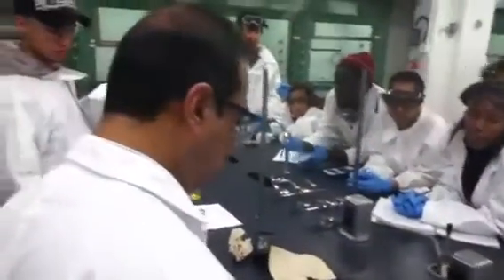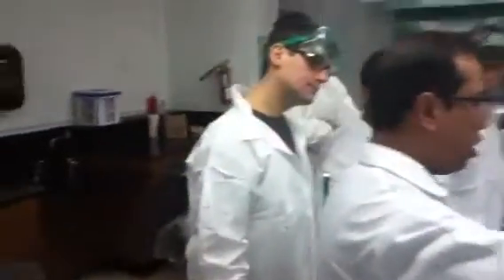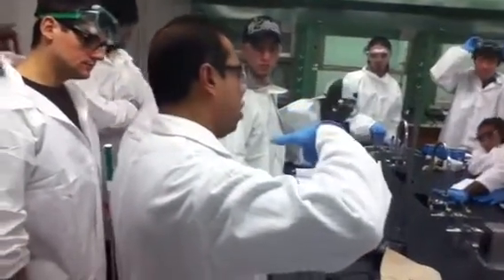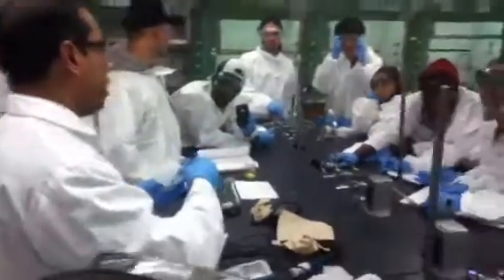No, no. Professor, what's in there right now? There's water in the bag? So remember, in the solution, we have the organic part, we have the toluene, right? I don't need the inorganic part, I just need the water in there. I want to show you one thing.